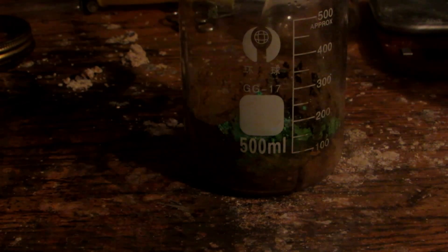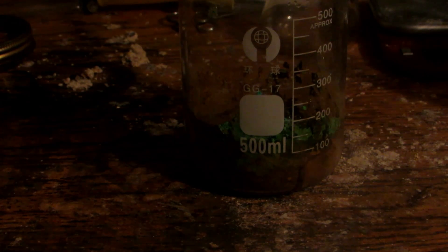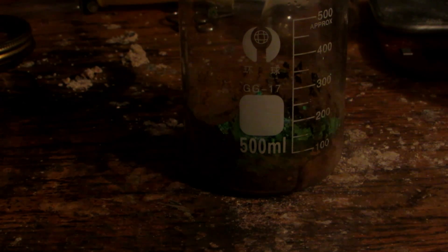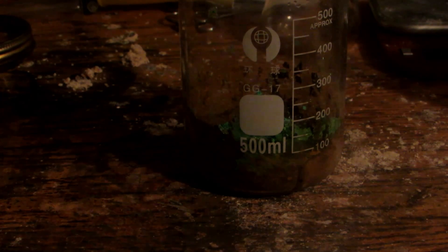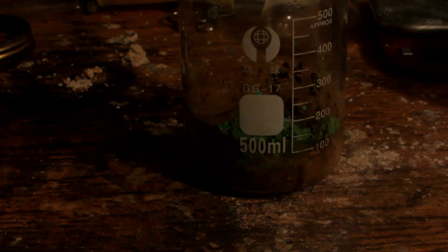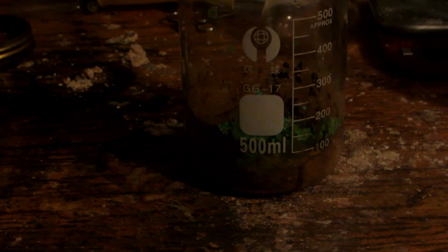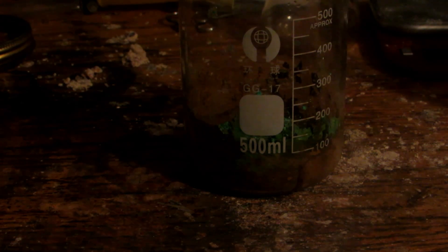I boiled everything down and stopped at this point where it's mostly brown with some green. The green stuff is copper chloride dihydrate and the brown stuff is anhydrous copper chloride — meaning there's no water. Copper chloride comes in a couple of different hydrates. Upon heating it decomposes into the anhydrous form, but upon leaving it out in the air it will reabsorb water and form the nice green copper chloride again, which is what we want for the chemical garden reaction because the beautiful green color will create the effect we want.